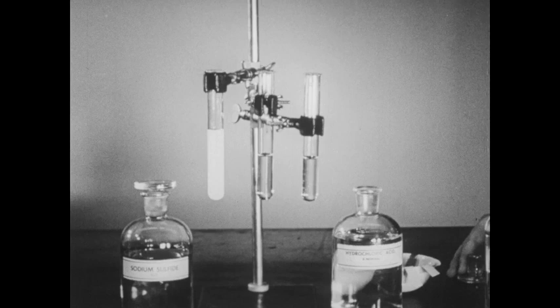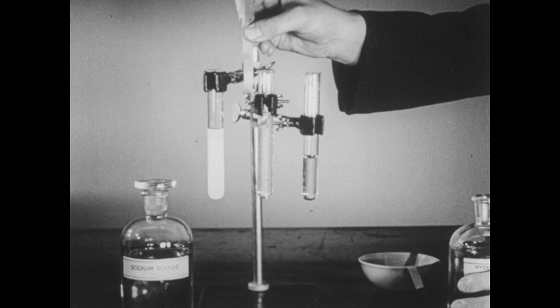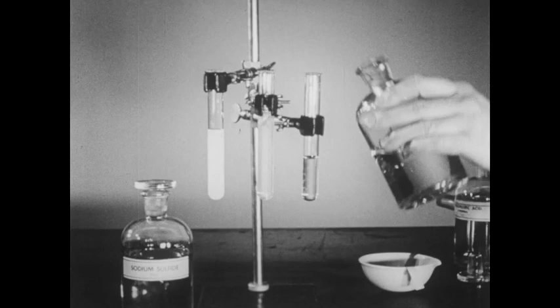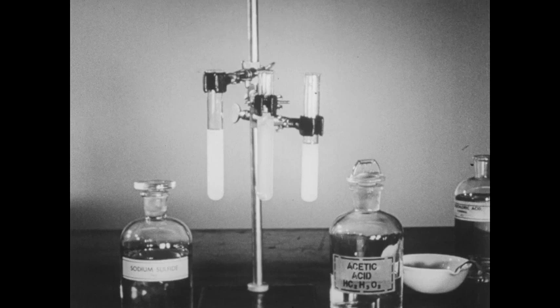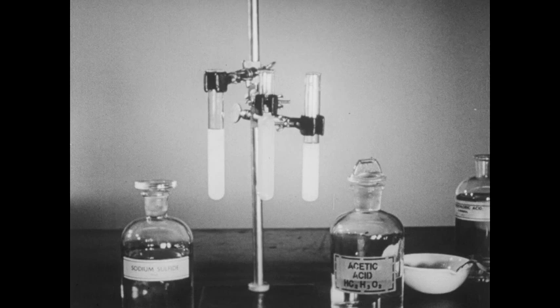To the middle tube, I'll add a few milliliters of dilute hydrochloric acid, and the same result is obtained. To the third tube, we'll add a small quantity of acetic acid, and once again the lead acetate paper is darkened. This experiment shows that hydrogen sulfide is a weaker acid than sulfuric, hydrochloric, or acetic acid, since these acids liberate it from solutions of its salt.